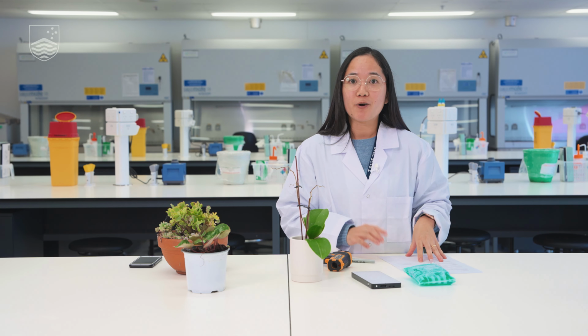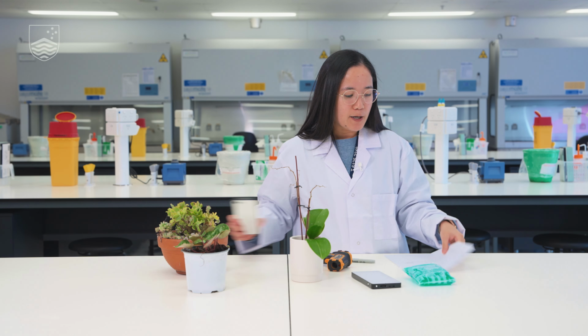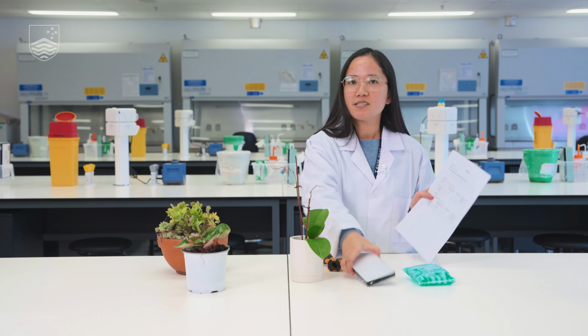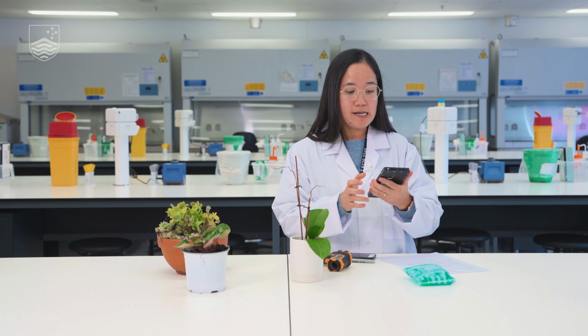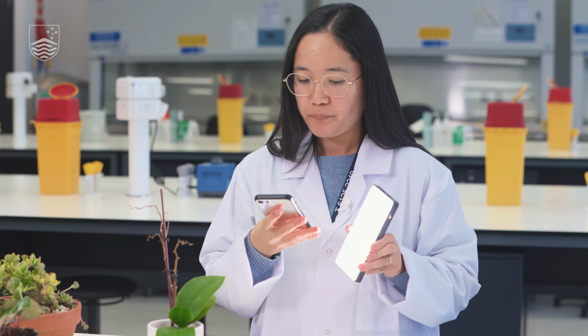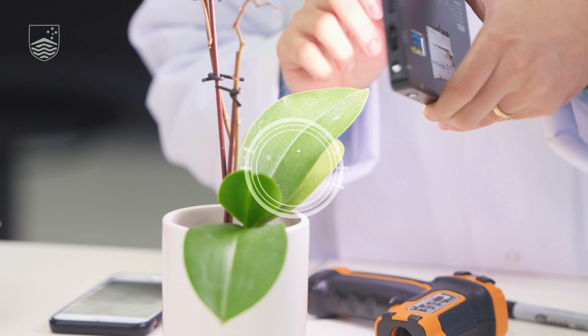Now we will do our treatment. The first row here, or treatment time, is 5 minutes. And so I think we will do the heat treatment first. That means we will use the torch. And then I have here my phone as a timer. So we can start for 5 minutes.